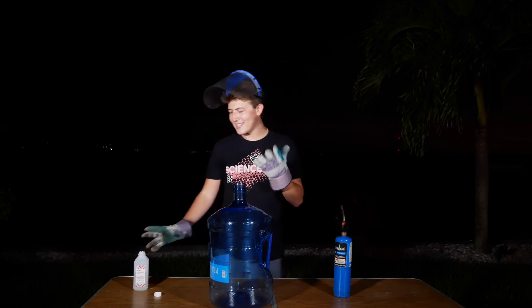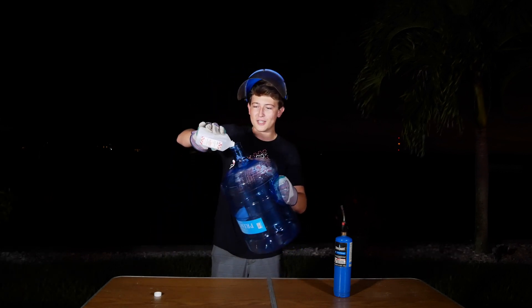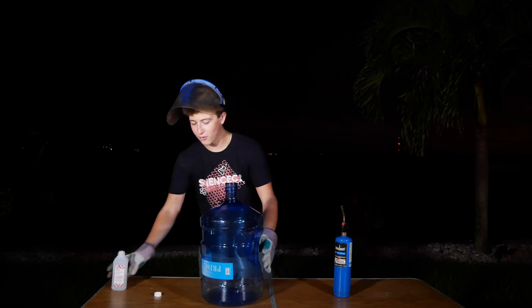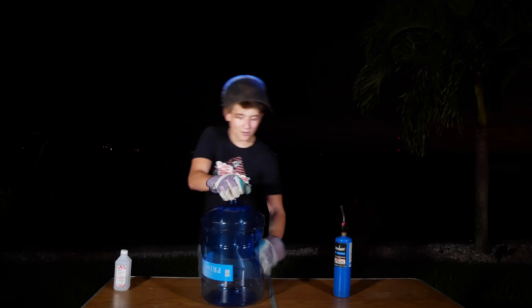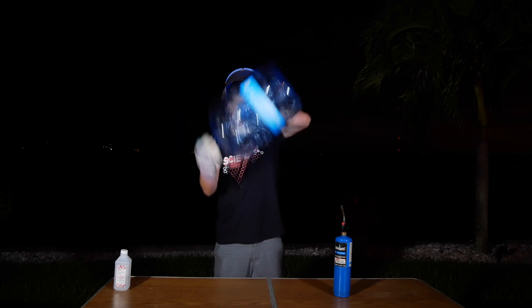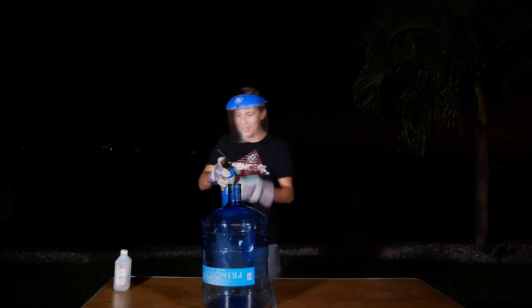Hey guys, you may have seen the classic chemistry demonstration where isopropyl alcohol is put into a five gallon water jug, and once you mix it with air, we create a nice mixture of isopropyl alcohol and oxygen — and now we can ignite it.